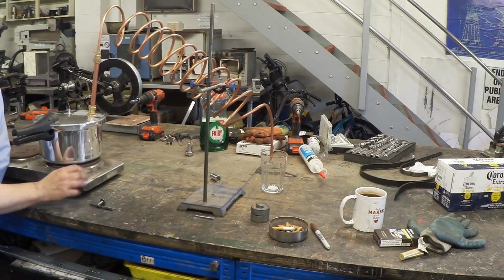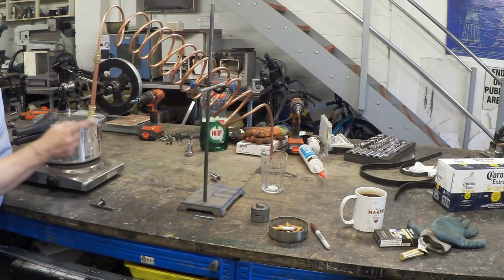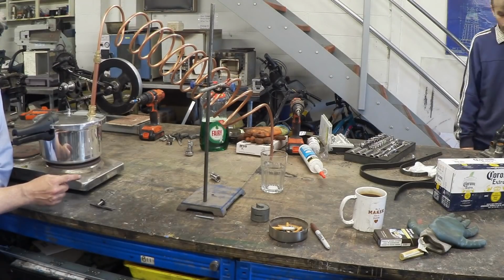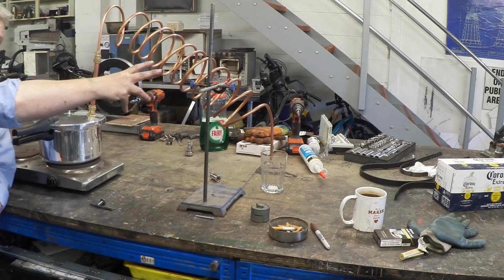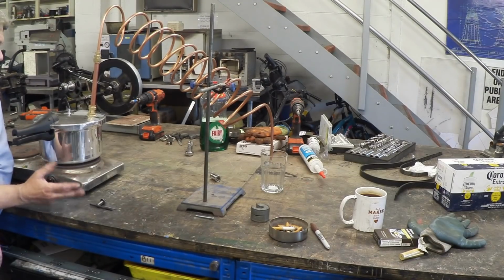So I've got it on this hob here. Now you control this by the heat because you want to boil off the liquid you're interested in. If you do it too vigorously, obviously you're going to get vapor out of the other end. So you need to control that heat so that the vapor comes off at a certain rate. If it's coming off too quick, you just get vapor out of the end of your pipe instead of drips, and you're looking for drips. If you're getting vapor, then you need to cool that, and you can cool that by dipping it in water, blowing cold air on it, or just simply making it longer. The easiest thing to do is to turn down the heat. If you turn down the heat, clearly it won't boil as vigorously. So those are your control parameters.